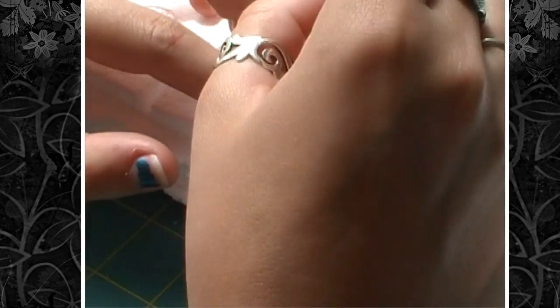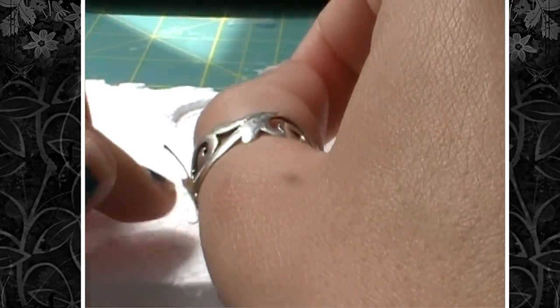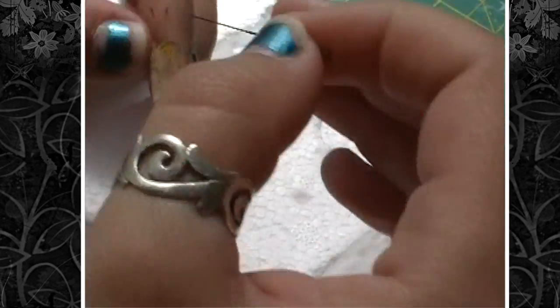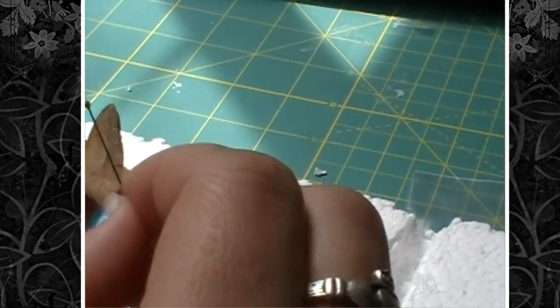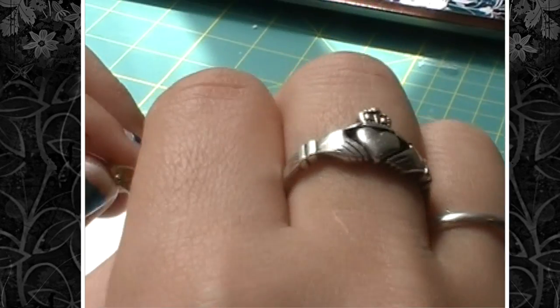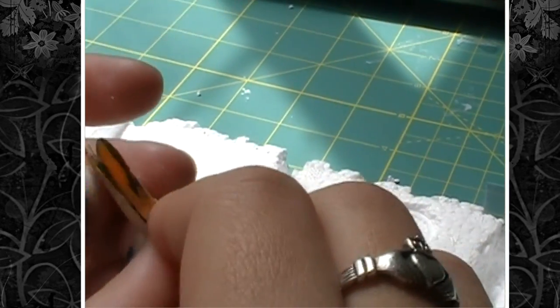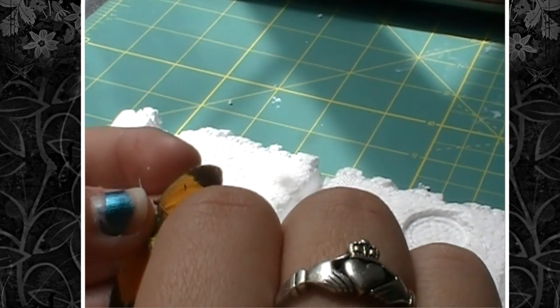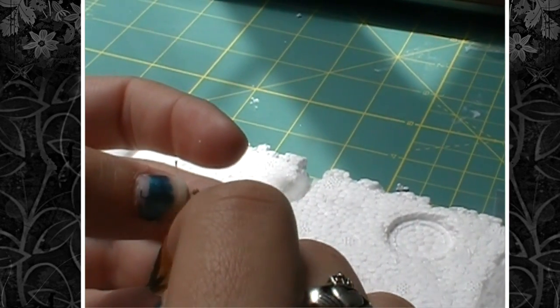The first thing you're going to do is take your butterfly and take the head of your pin, slip it in between the two wings, and push the wings down as best as possible to break the wing muscles. This will ensure that he'll lay flat while you're trying to spread him.